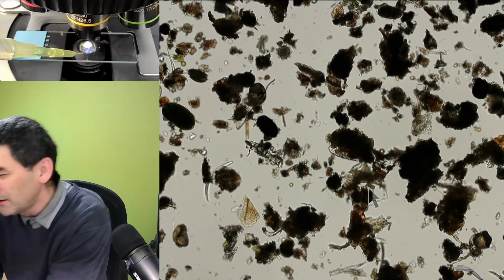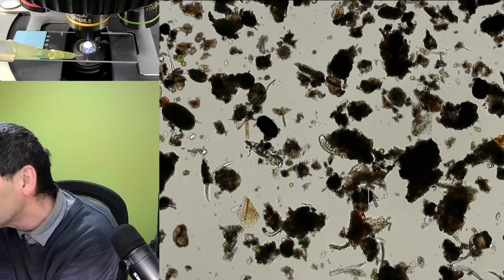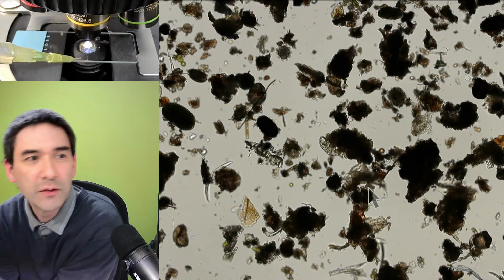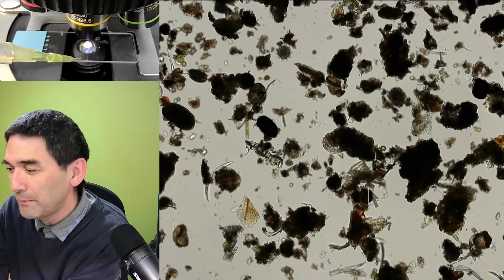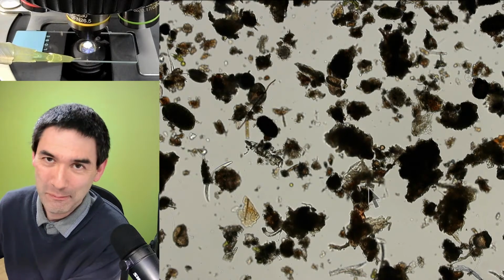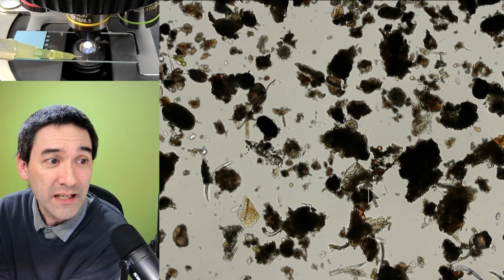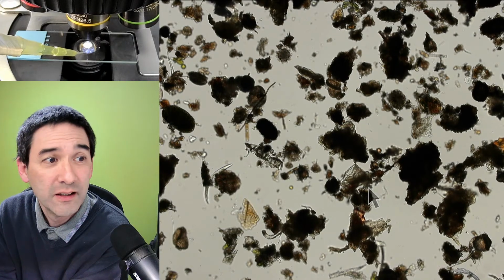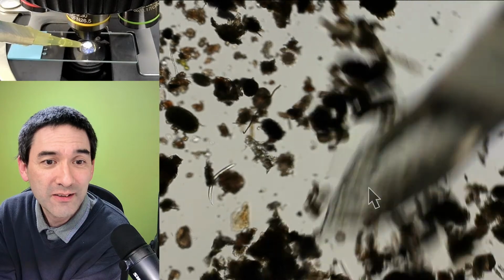I need to lower it a little bit. It's still a little too high up. Okay, here we go. This is a little pipette, and I will show you how it works. It's actually surprisingly easy, and it does work a little bit. I'm going to show you all of the advantages and disadvantages. I'm now going to move it into the water droplet. Let's see, where is it? Here it is.